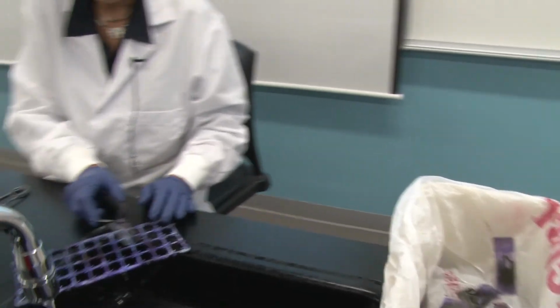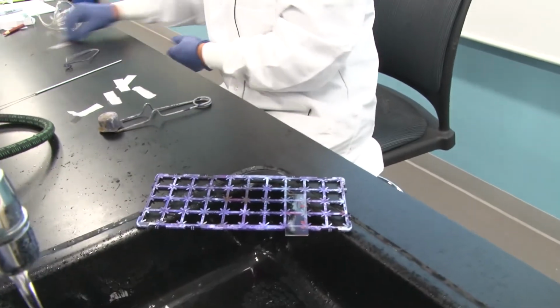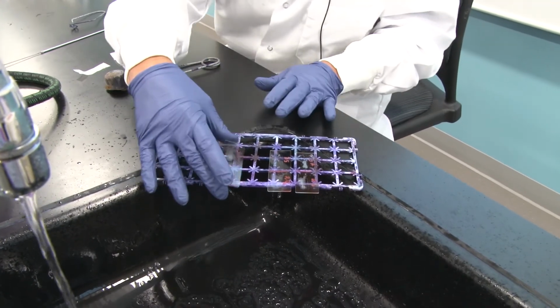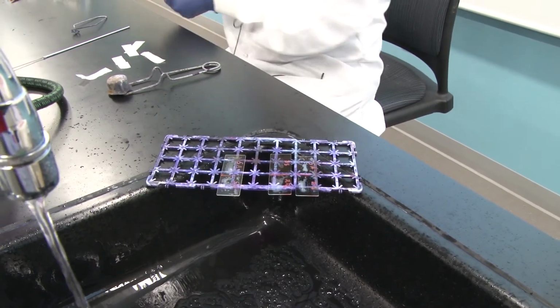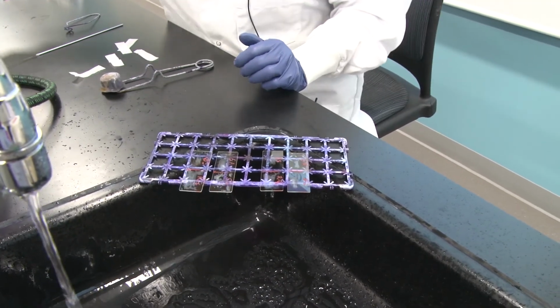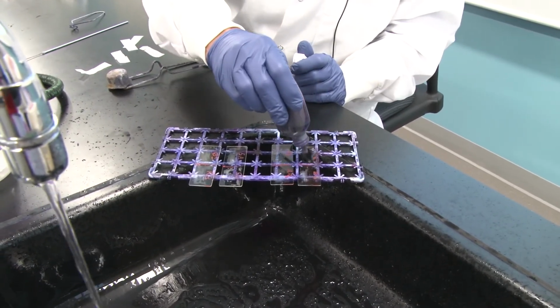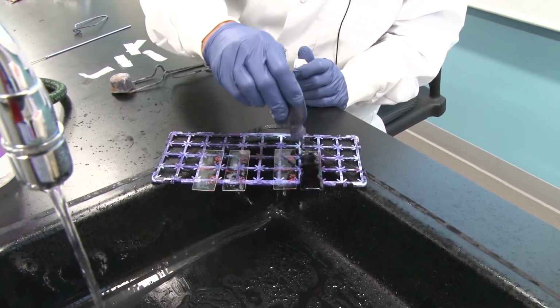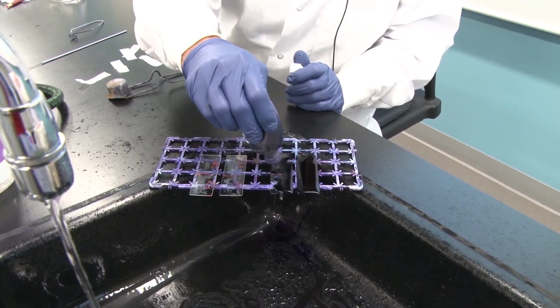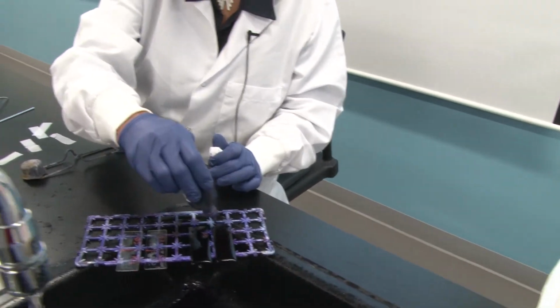Over here at the sink, I have my slide rack. I'm going to place each and every one of my slides on the rack for the simple basic stain. The simple negative stain is still air drying. One set of these slides, I said I was going to stain with the basic dye known as crystal violet. Whenever you stain a slide, you stain the entire slide. You cover the entire thing with dye. You don't miss any part of it. You want to make sure the entire smear is covered.